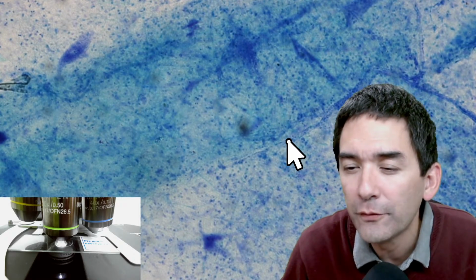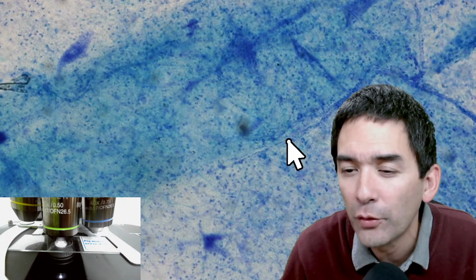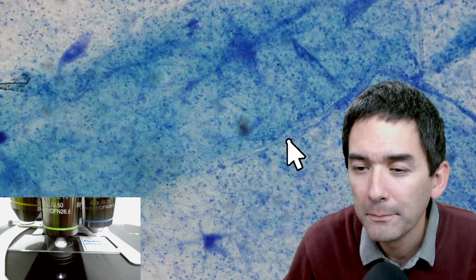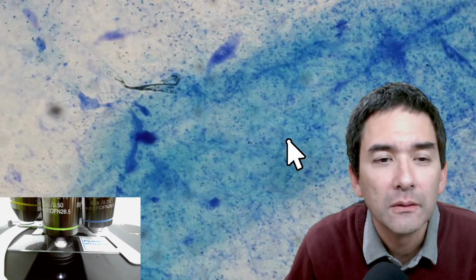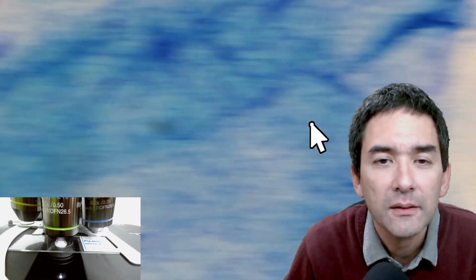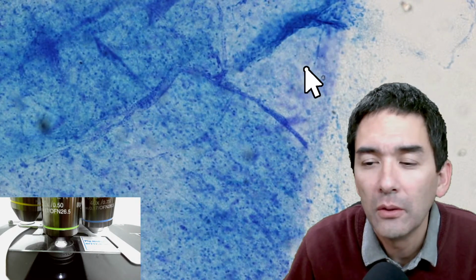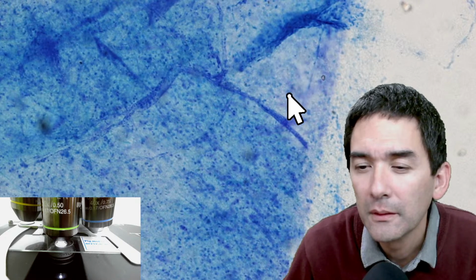So there's another comment here. The International Agency for Research on Cancer classifies formaldehyde as a human carcinogen. Okay, yep. So that's, yeah, here as well. You see those long things here? Yeah.